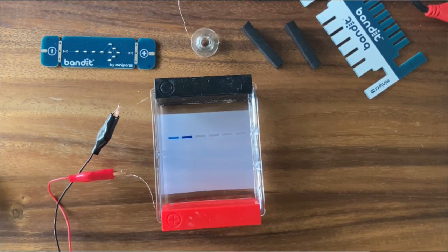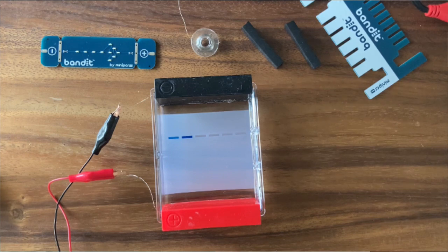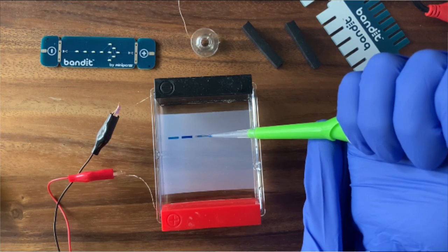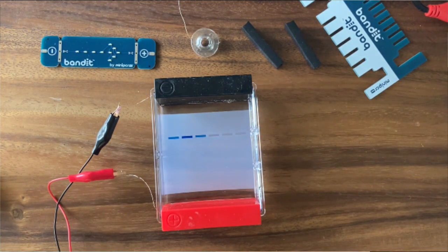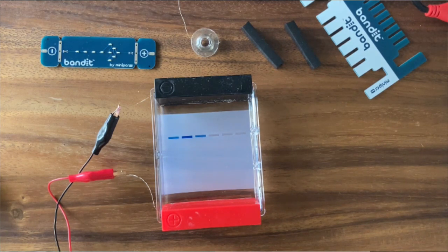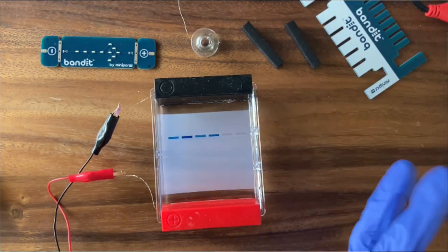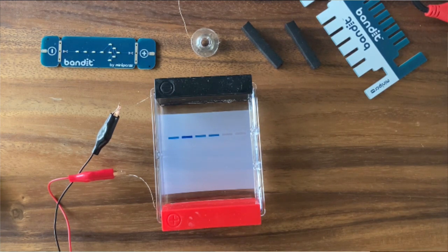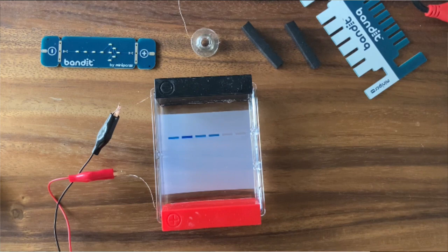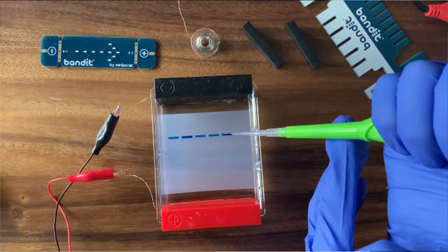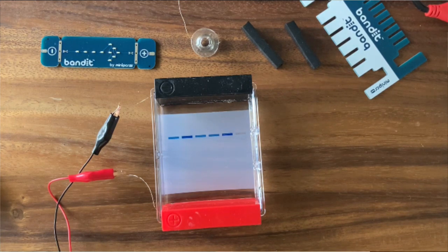You can see my samples are dyed blue. In fact, they're blue dye samples. I'm not actually loading DNA, but a blue dye sample instead. As we've discussed, electrophoresis works with any charged molecules. In biology, we often talk about using electrophoresis to separate DNA, but you can use it to separate other types of charged molecules as well. This is actually one of the new dye electrophoresis labs that we've released especially for the Bandit system. At this point, I do want to emphasize Bandit doesn't come with samples to load. Bandit itself is a hardware kit. In order to use it the way I'm using in this webinar today, you'll need to purchase a lab kit which will contain the samples that you'll load.